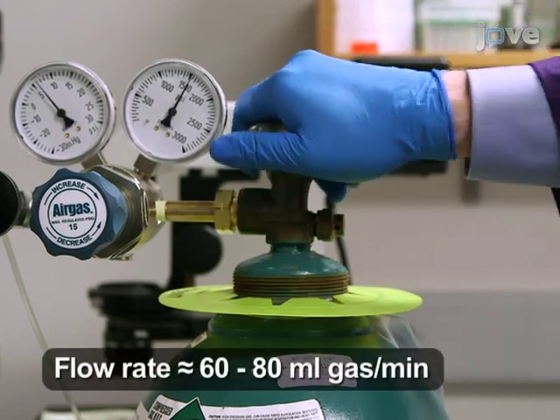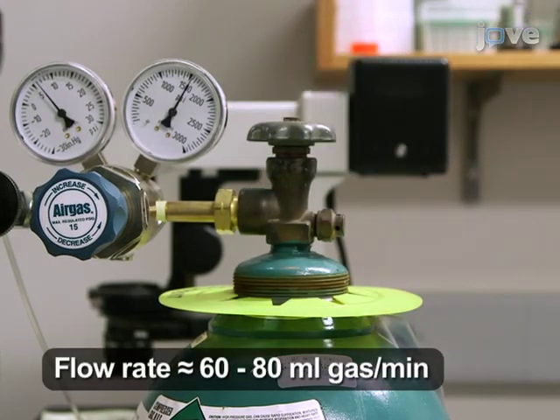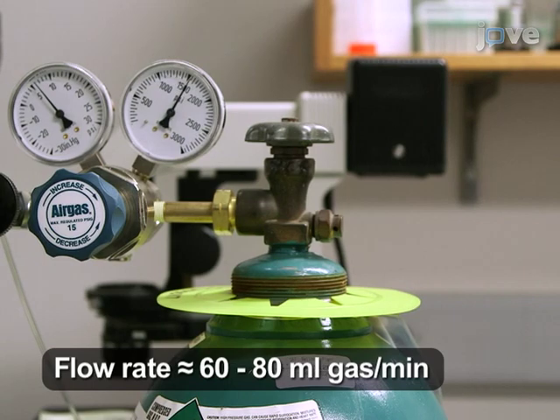Finally, open the control valve on the 5% carbon dioxide, 95% atmospheric tank to provide carbon dioxide supplemented air to the stage-top incubator.